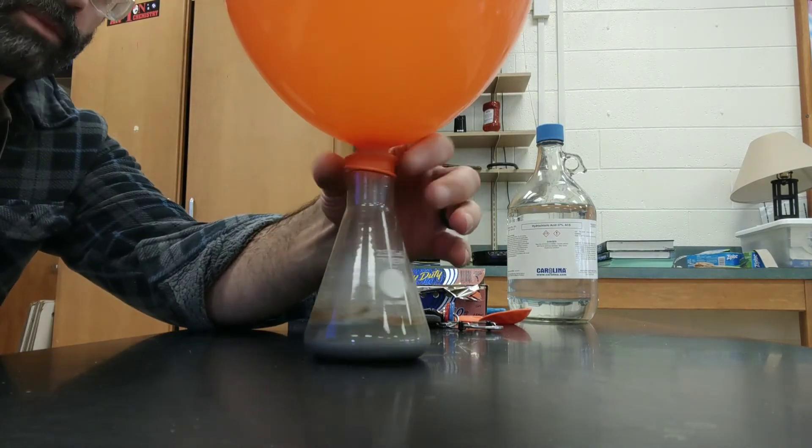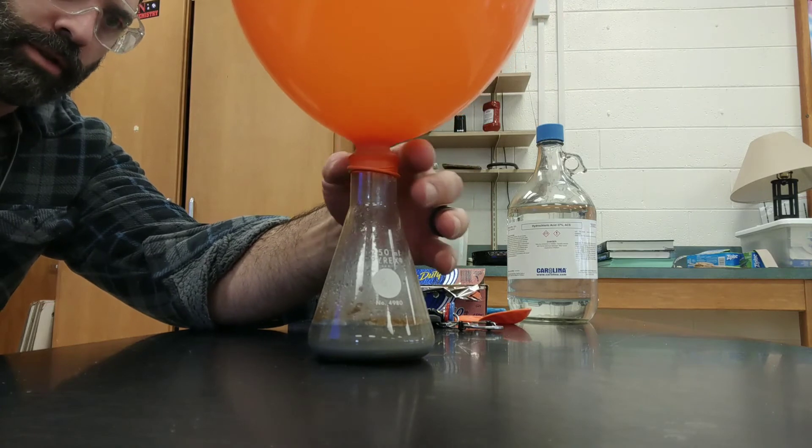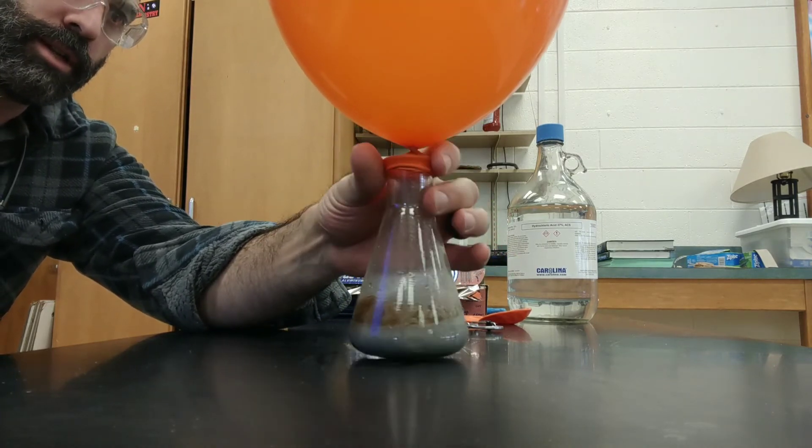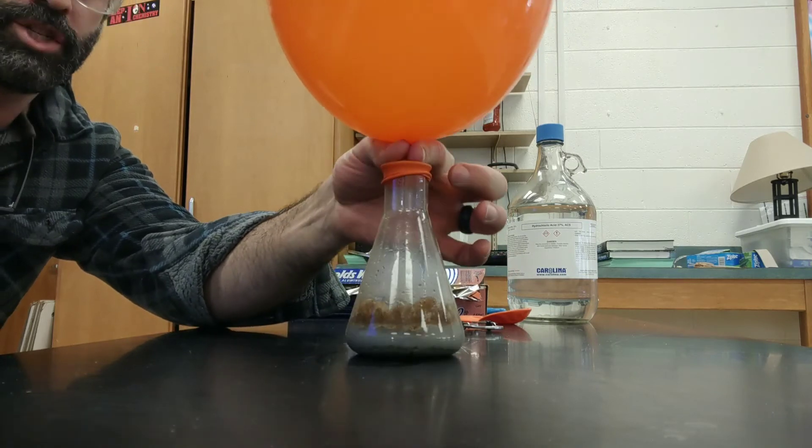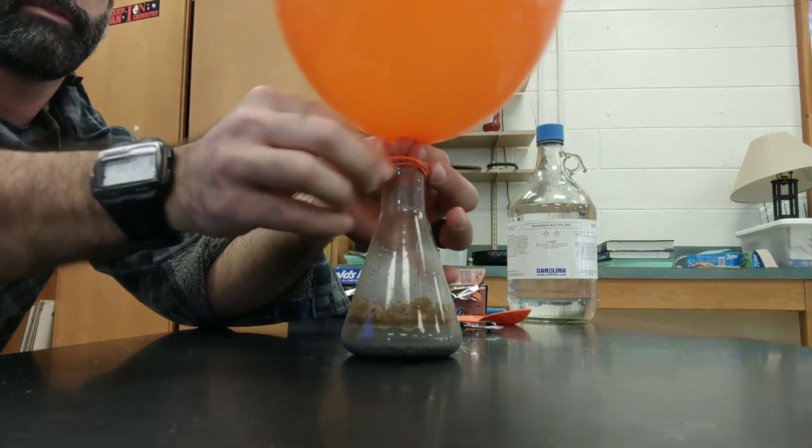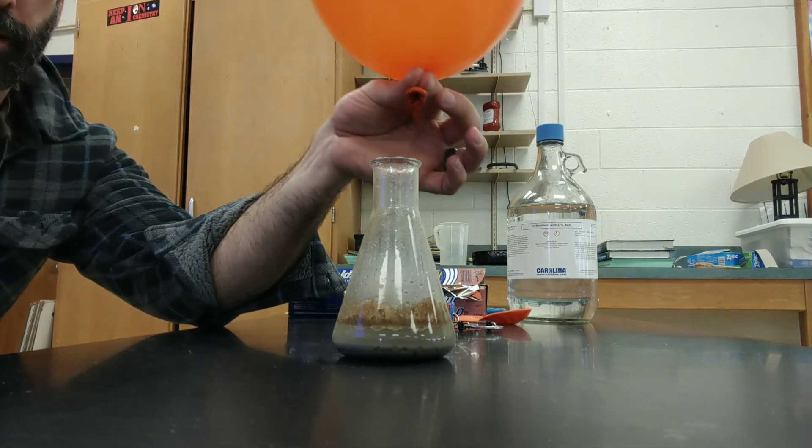Alright, so what I'm going to do now, because the reaction is pretty much over, I'm going to twist the balloon a couple of times. I'm going to pinch it. I'm going to pull the mouth of the balloon off the mouth of the flask. Just like that, okay?